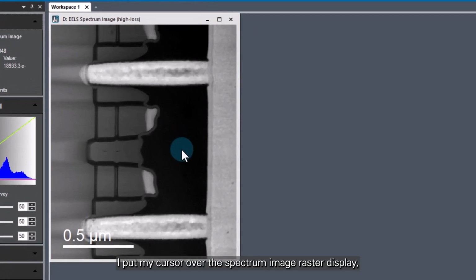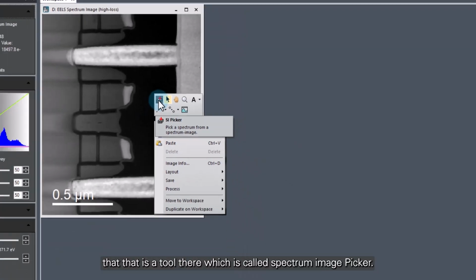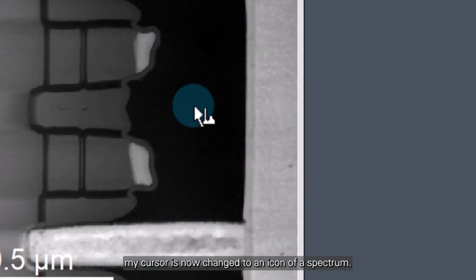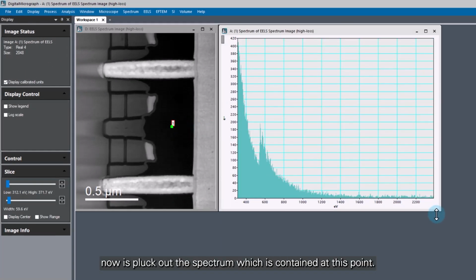So to do that, I put my cursor over the spectrum image raster display, I right click, and we can see in the floaty that opens up here that there is a tool there which is called Spectrum Image Picker. If I click on that, what you'll see is my cursor is now changed to an icon of a spectrum, and if I click on my spectrum image, what we'll essentially do now is pluck out the spectrum which is contained at this point. Now there are a couple of things to note here.